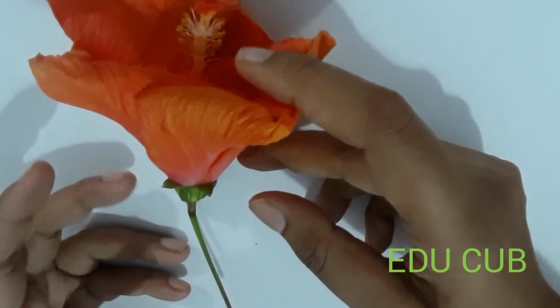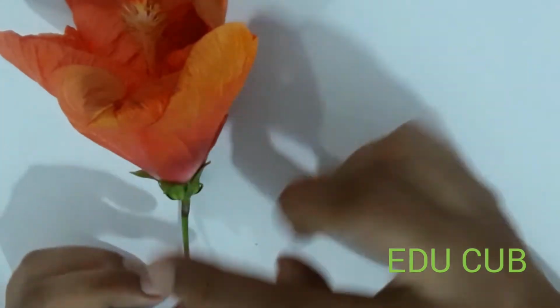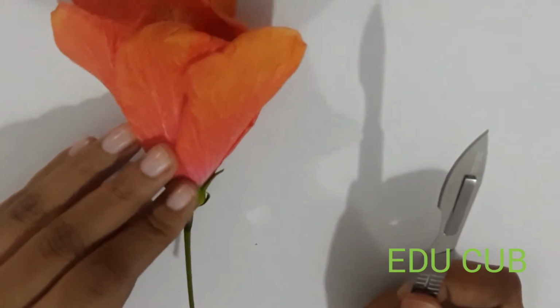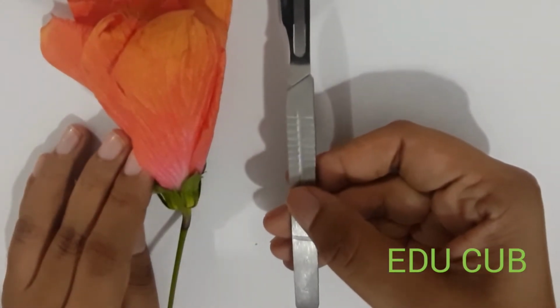Now we are going to identify the parts of flower by observing half flower of a shoe flower. Now we are going to cut this into two halves. Right? Select a bigger flower when you are doing this practical. Cut and separate the flower into two parts longitudinally. This section we call the longitudinal section. By carefully cutting it from pedicel using a sharp blade. I am using this type of sharp blade for this one. Let's cut it.